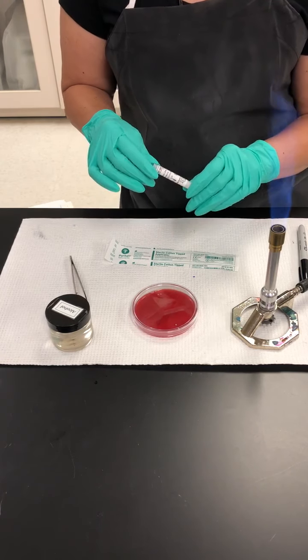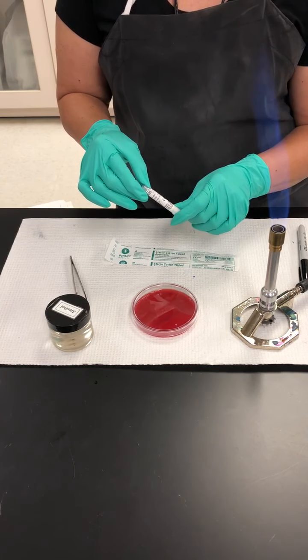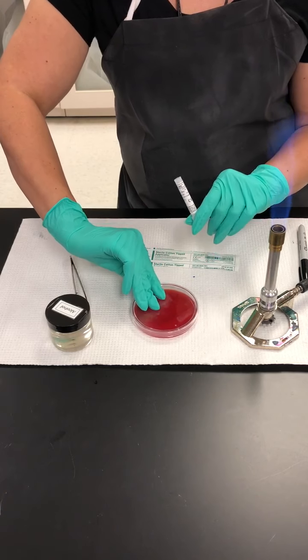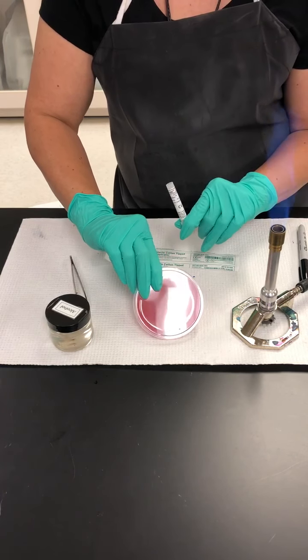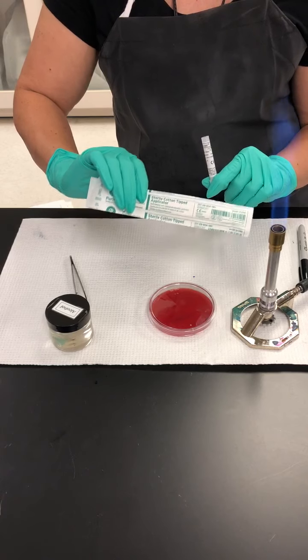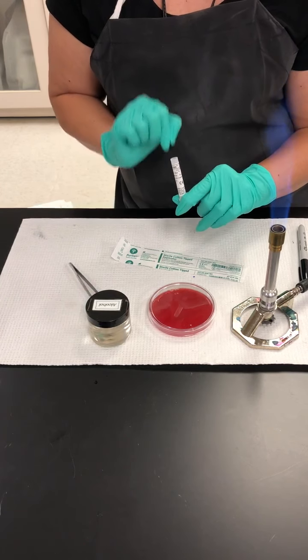The type of antibiotics that we may use when we're in between two organisms are going to be optochin, Novobiocin, or bacitracin. I'm using Novobiocin today as the example, and as it is a gram-positive cocci, we prefer to grow those on blood agar, which is what I'm going to use for the demonstration. You will also be using a sterile cotton tip applicator. We're going to have alcohol, we're going to have forceps so that we can actually do this aseptically.